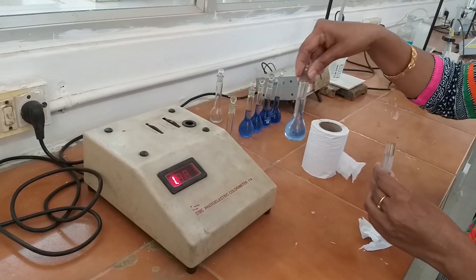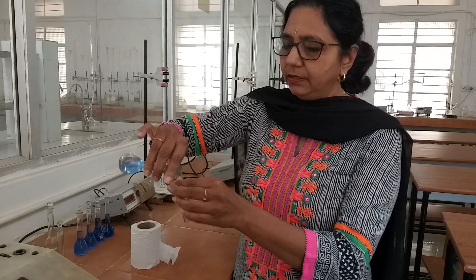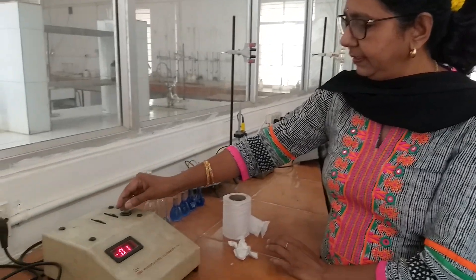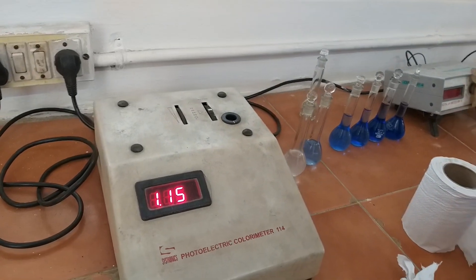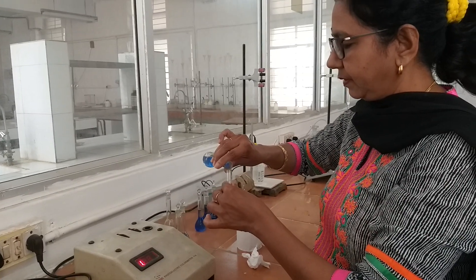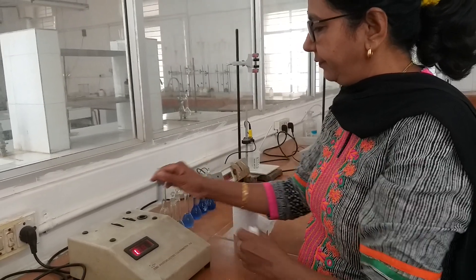Once adjusted, remove the blank solution from the Nessler tube and fill it with the first solution — that is, 2.5 ml copper sulfate. Wipe it with the tissue paper, place it in the instrument, and take the reading. We will repeat this procedure, taking one by one the different solutions and recording the absorbance at 590 nanometers.